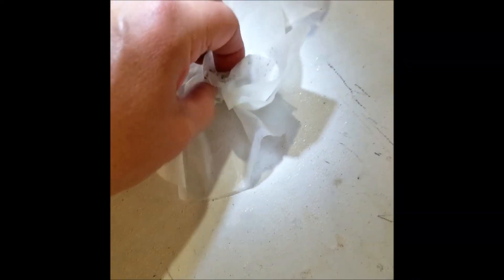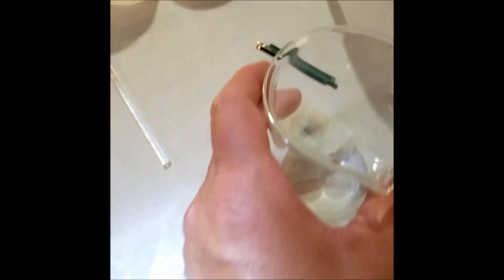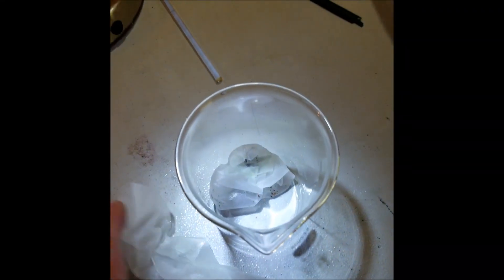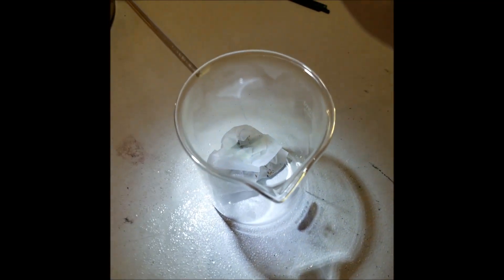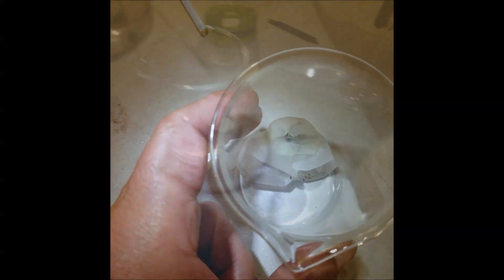What we're going to do next is take the filter paper, separate it from the bottom one since there were two of them, and stuff the whole thing into this beaker here with all the gold flakes right there. The filter paper won't matter, it just doesn't matter if it's in there with the gold. For the next couple of steps, we will end up filtering it out.